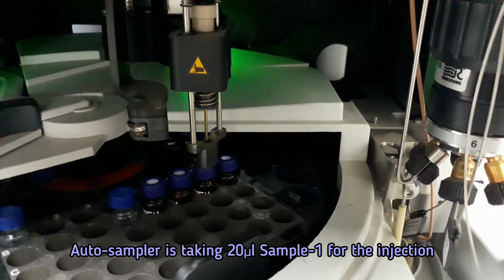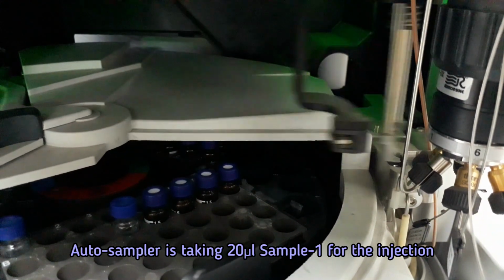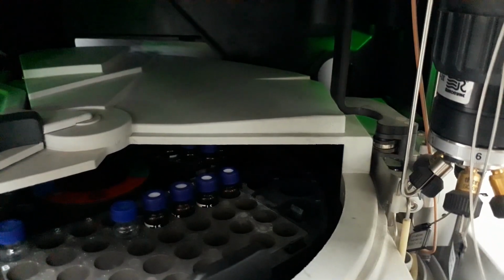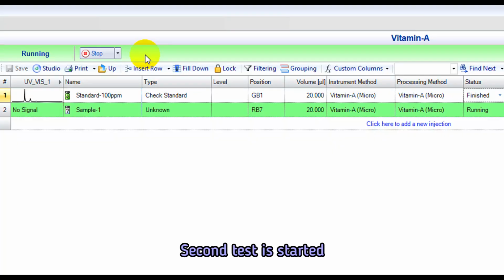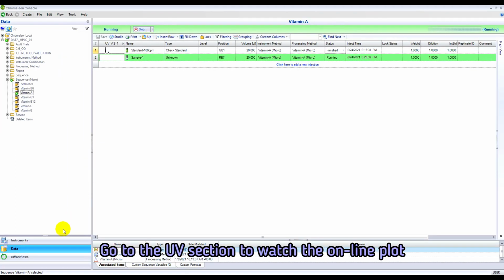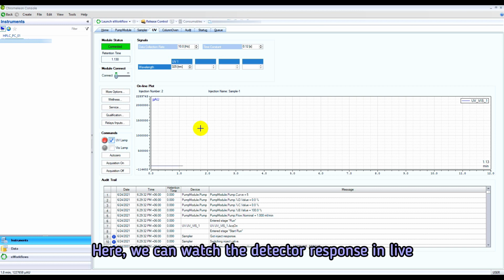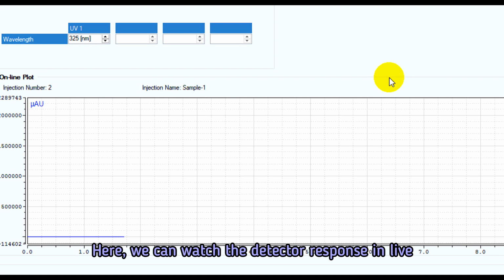Autosampler is taking 20 microliter sample solution for the injection. Go to the UV section to watch the online plot of our sample. We are looking for the detector response at 2.9 retention time.